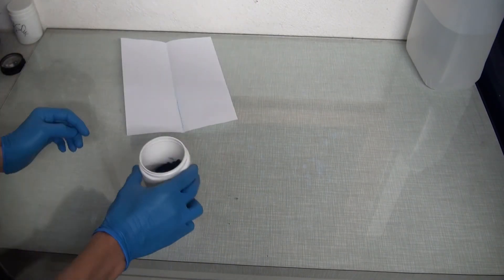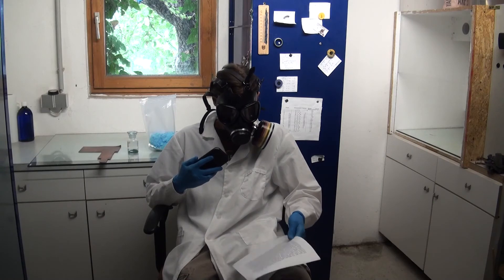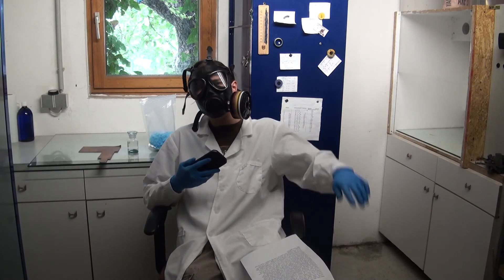The crystals were added into a storage container. I hope you liked my video. Bye.